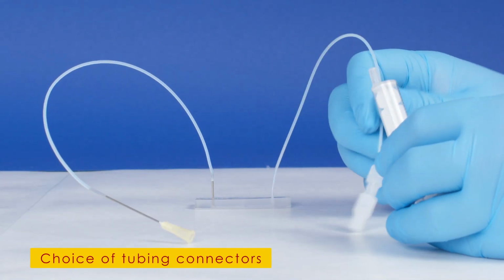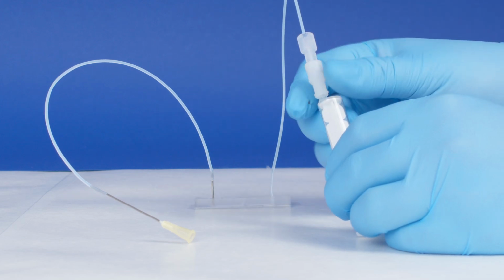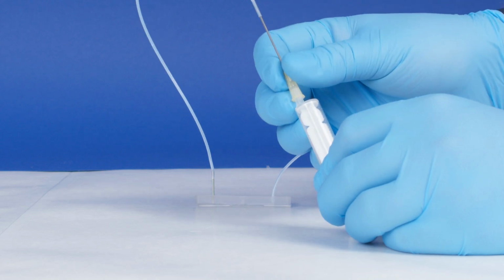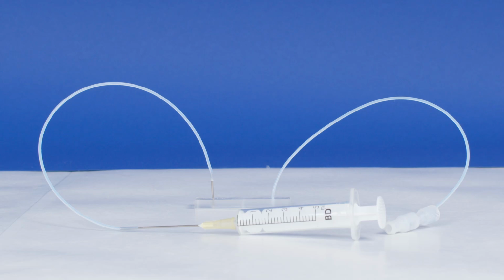Commercially available microfluidic connectors can help you avoid leakage issues, but are also pretty costly. Alternatively, you can use blunt needles of a bit bigger diameter than the orifice to which it is connected.